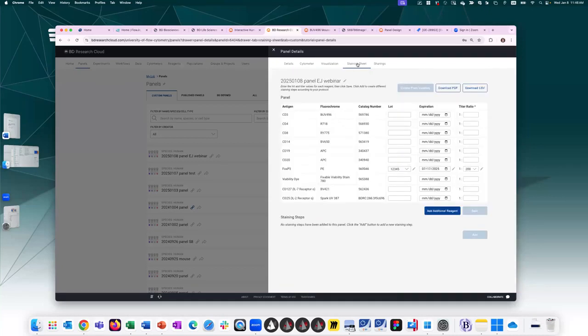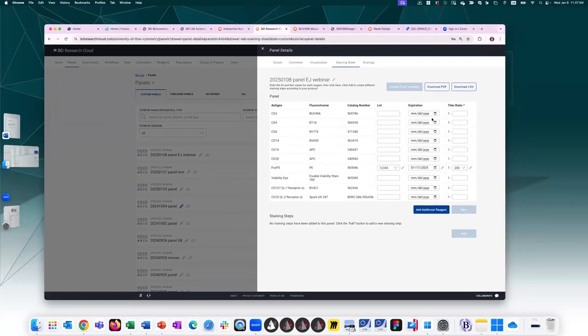There is a staining sheet option for finalized panels. If you have this reagent in your inventory, and if you've already added titration information, whenever you create a panel with this marker, this gets pulled in automatically. So it shows me what lot is already in my fridge and what titration value I've assigned it to. So if these were all added in my inventory, this would all come pre-filled and I wouldn't have to go hunting for titration information in various places.